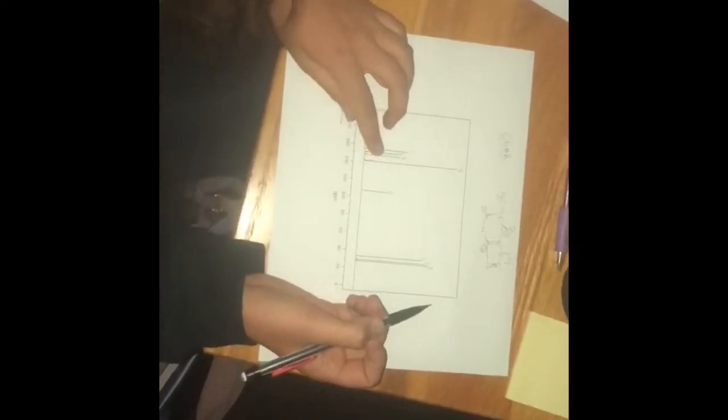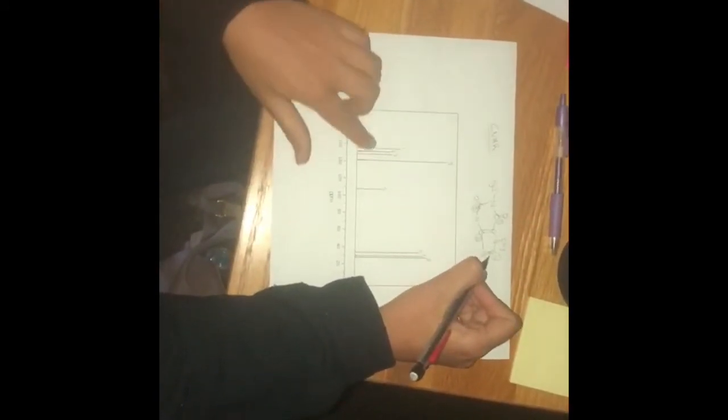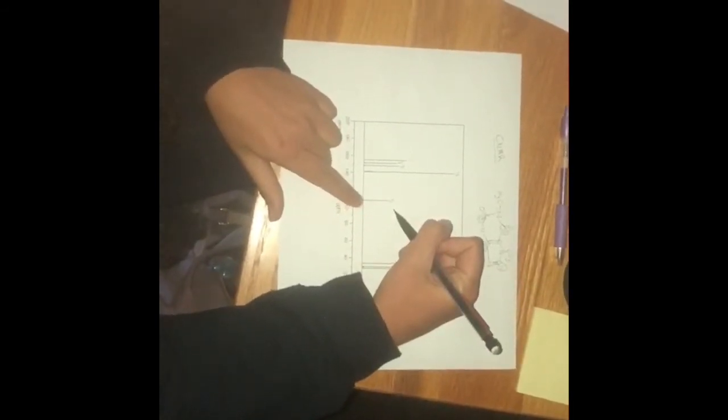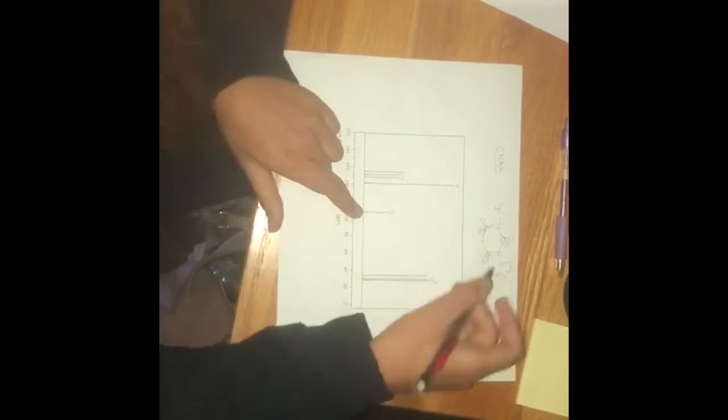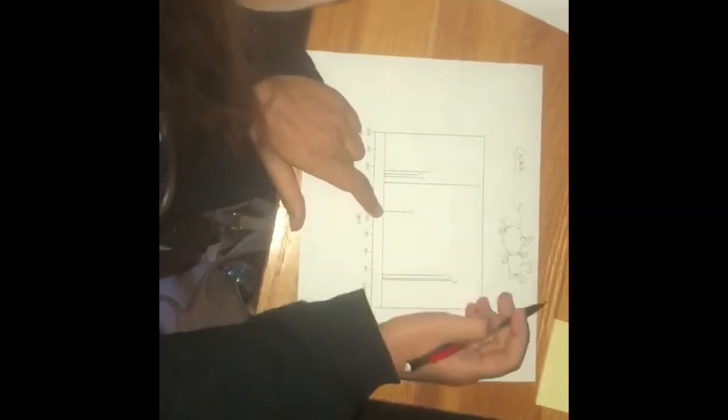The third one is going to be here, which is also the C double bond O, which would make sense. And the fourth one is over here, bonded to this nitrogen. So then these are all kind of grouped together, and then 5 is farther upfield, and 5 is right here, in the middle of these two.